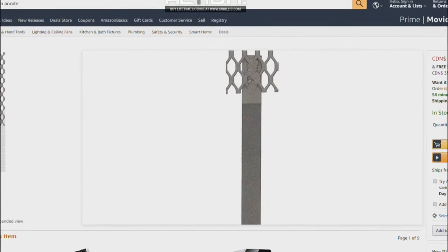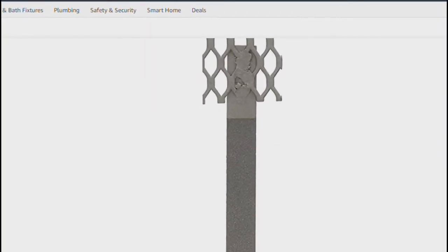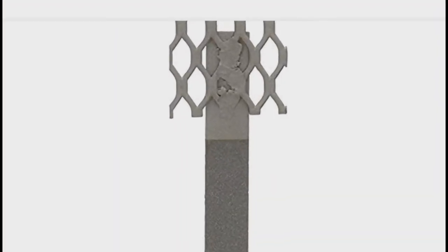And this is the anode off of Amazon that Nerd Rage recommends and has proven to be genuine in his videos. As you can see, you can clearly see that defined line where the anode came out of the solution. And the texture is much different. It's much darker, it's much coarser.